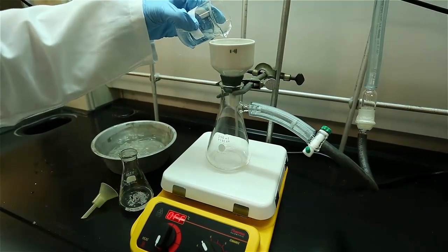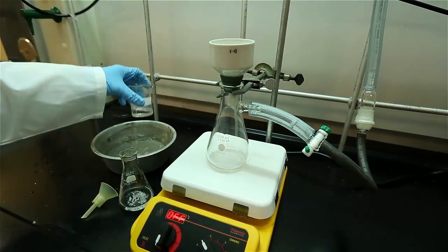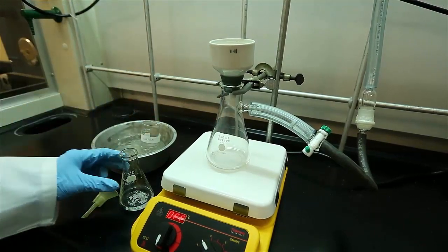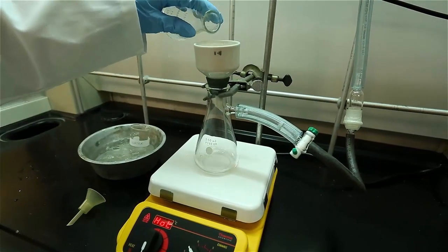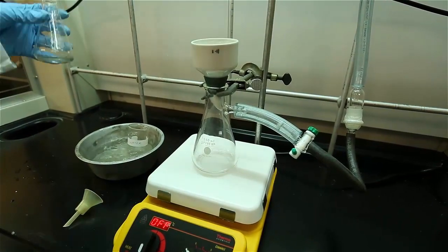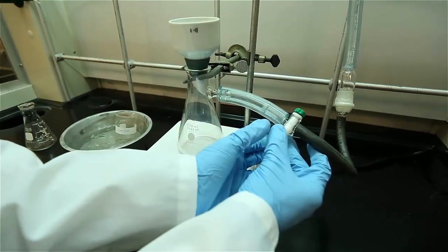Be sure to wet the filter paper with cold solvent. After filtering your solution, wash the crystals with a small amount of cold solvent. Allow the vacuum to run for 10-15 minutes or until the crystals appear dry and not sticky.